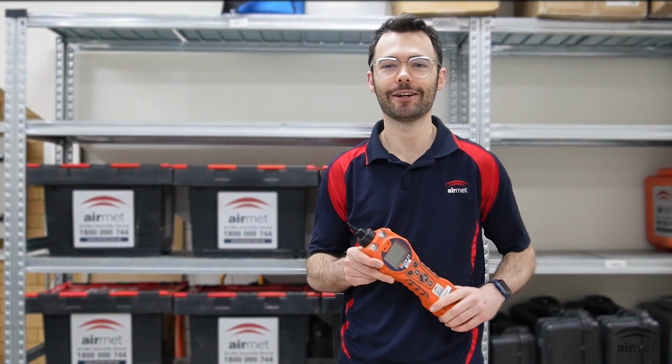And welcome to our video on how to change the units of measure on your Tiger XT PID. The Tiger XT is a powerful and versatile gas monitor that can be used to detect a wide range of volatile organic compounds, or VOCs.